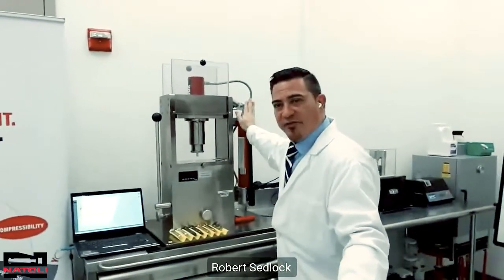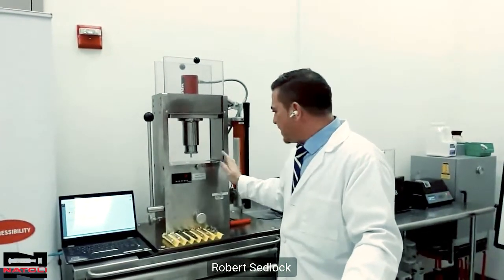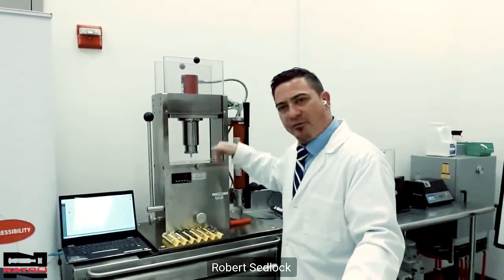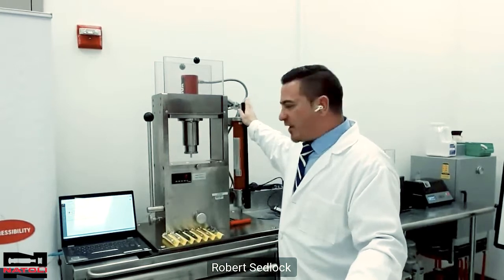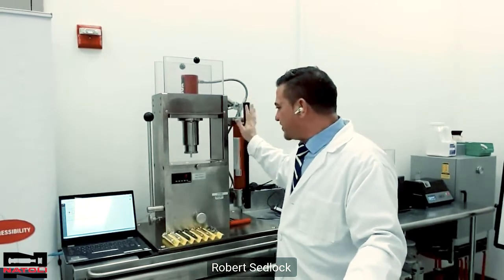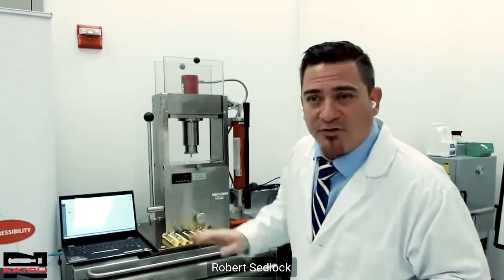This machine is a hand press, though you can also get it as an automatic press — hit a button and it automatically compresses for you. It's a very easy manual tablet press that's instrumented with the AIM data acquisition system.